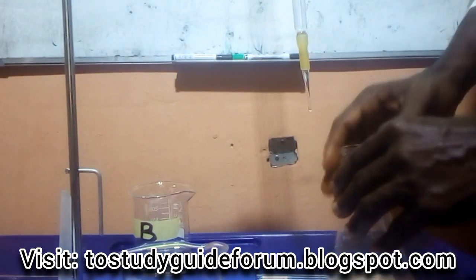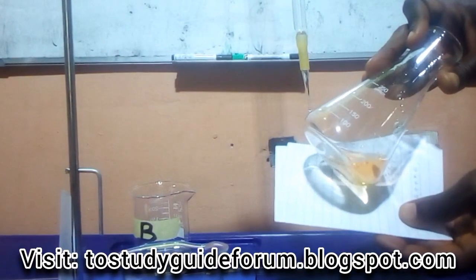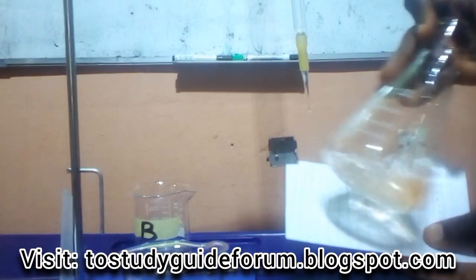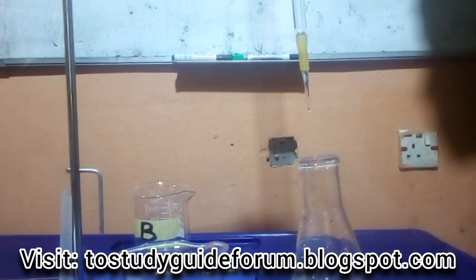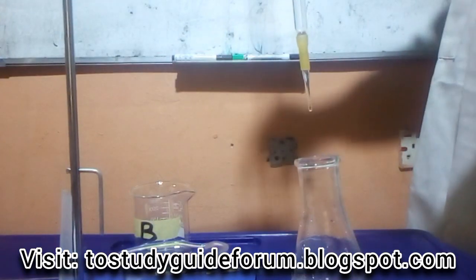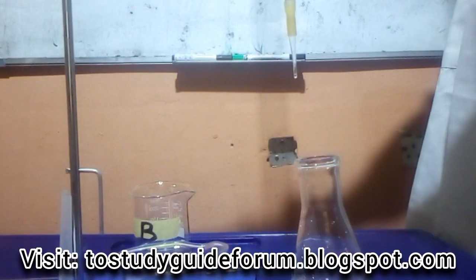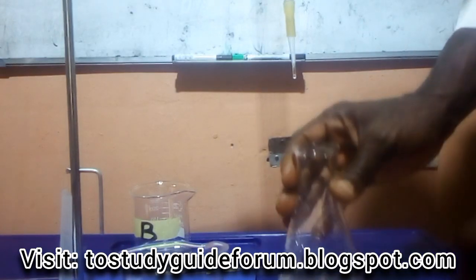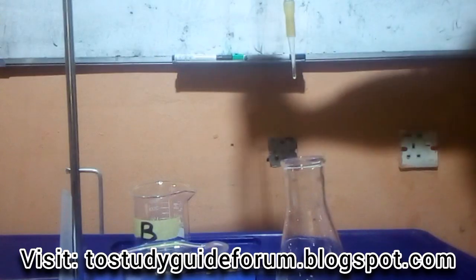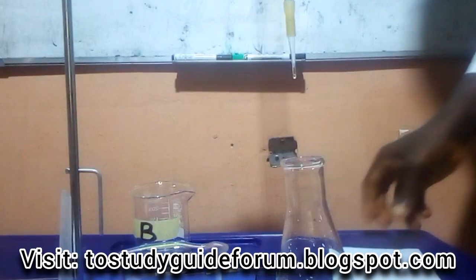The color has changed again. You can see the color has changed. This is another color here. So our orange color again. Now let me take my reading. So this one is 24. Let me get this thing closer. Now I started from 12.1 and ended at what? This one ended at 24.